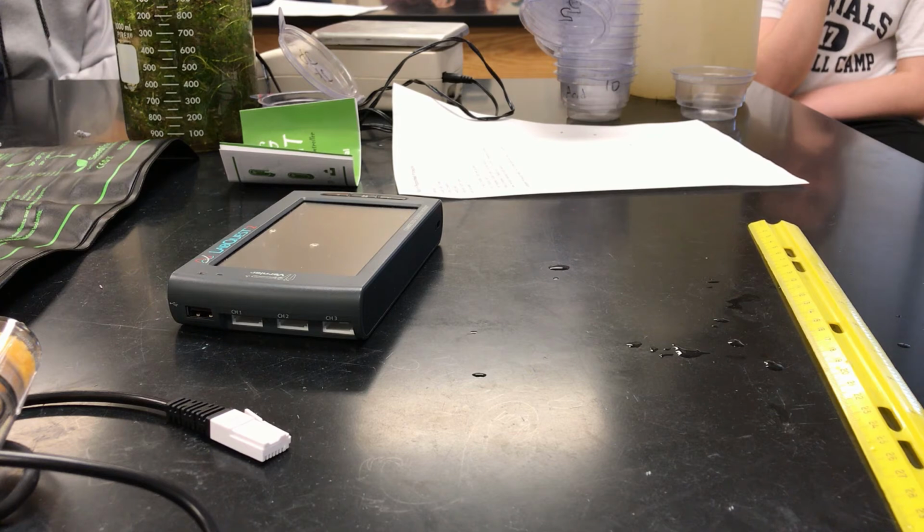And that's what we always try to do, age it at least 24 hours. I probably will set up an extra jug of it in another room stashed away for the inconsiderate group that forgets to refill it, and then the next group sets up the next day and is all mad. But we'll have a couple of extra containers, so you'll be fine.